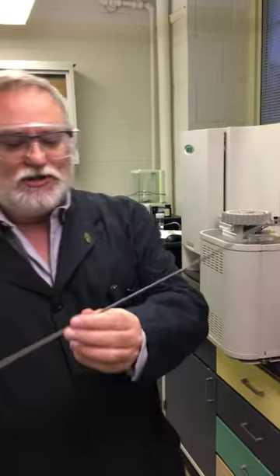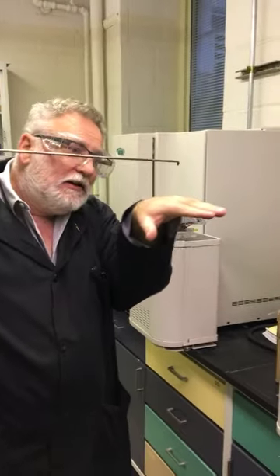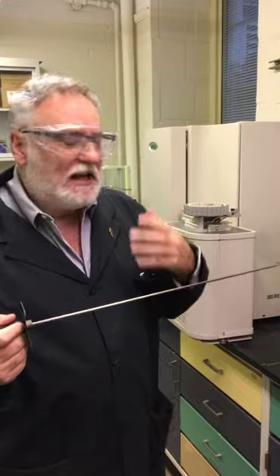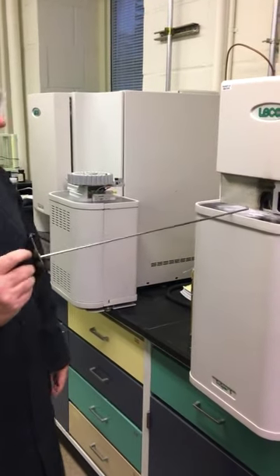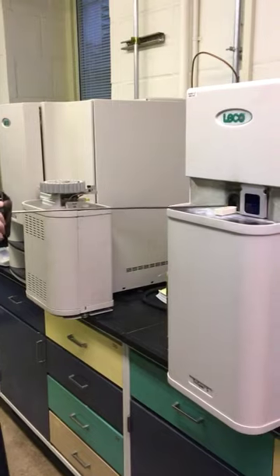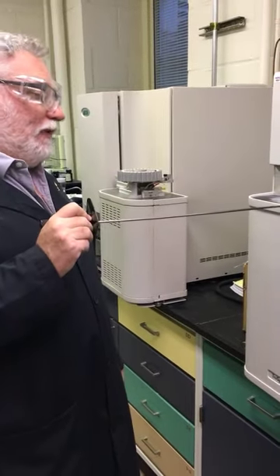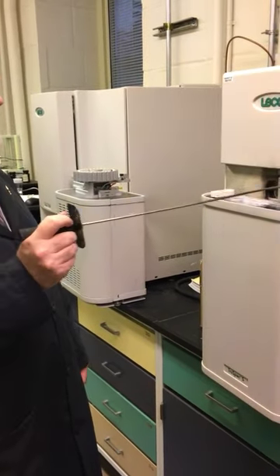There is an oxygen lance that sits right above where that ceramic boat is sitting, and that's where the oxygen is coming in. We do vary the flow rates and do other things that are a bit of a detail to work that out. When it's ready, I'd be able to use this again to go in. You need to be careful not to hit the ceramic oxygen lance because it's very, very brittle, and this would come out glowing red hot. So that's why this shelf exists.